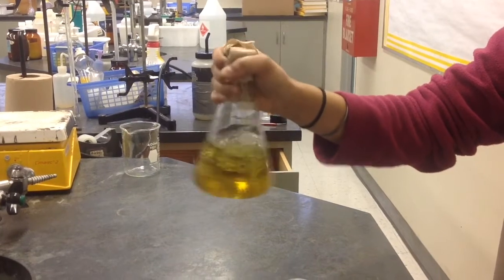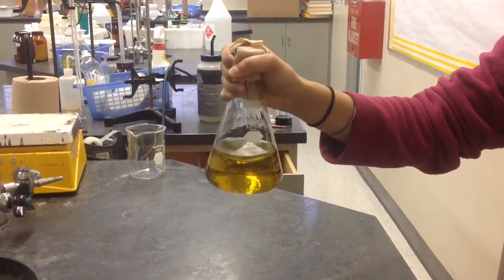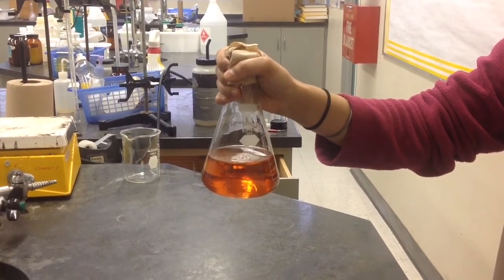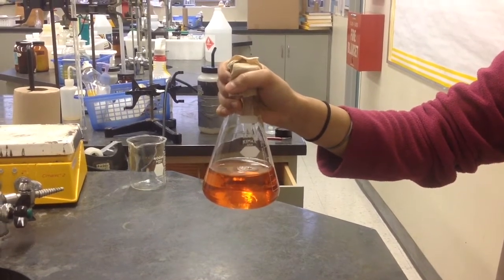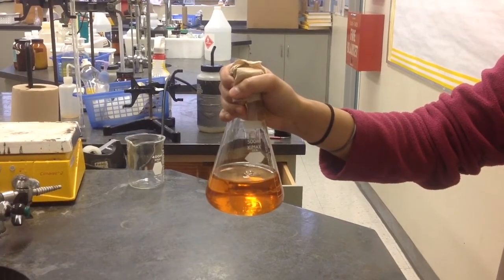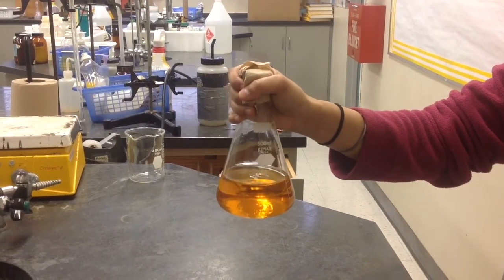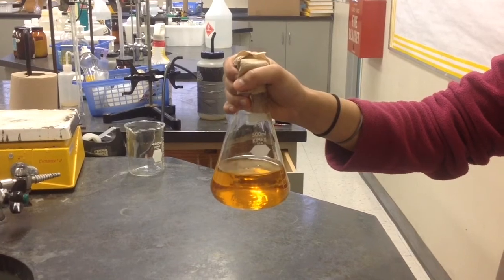The instant that we stop all movement, the solution returns to a red-orange color, and later a red. As the solution completely stills and all movement is stopped, it returns to its original yellow color, but this happens very slowly and may take a minute or two for the reaction to be completed.